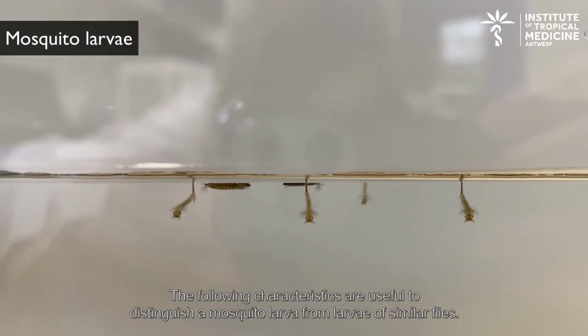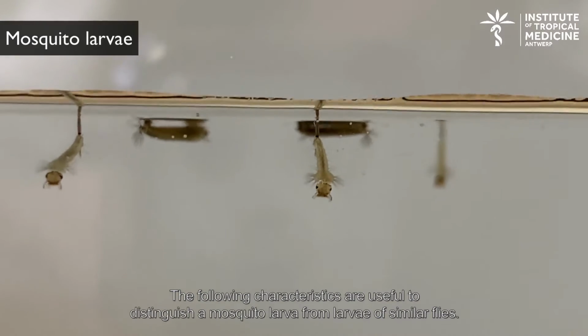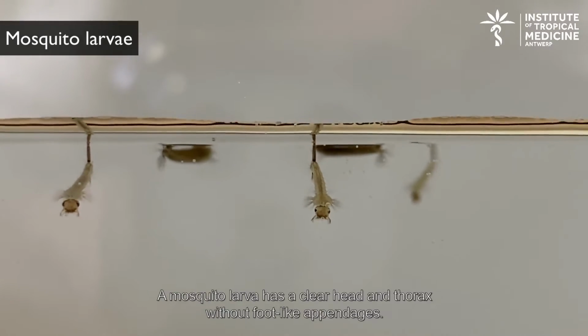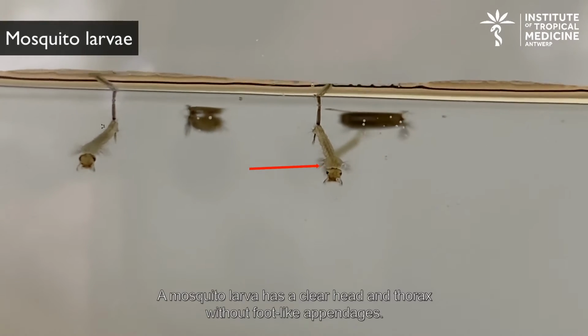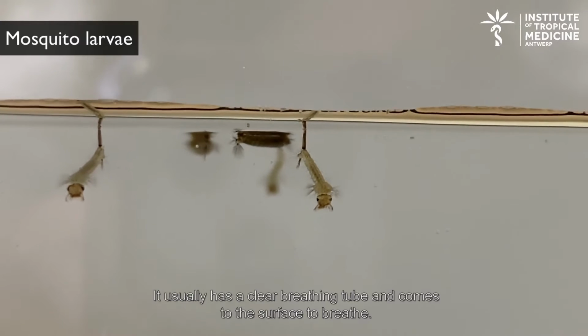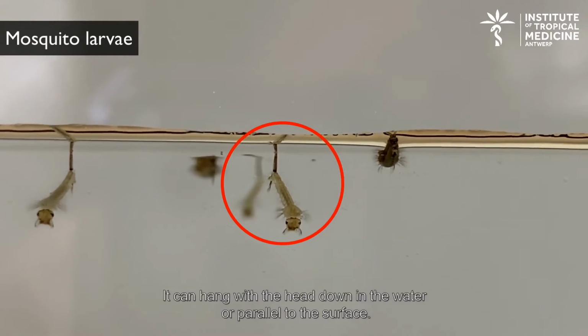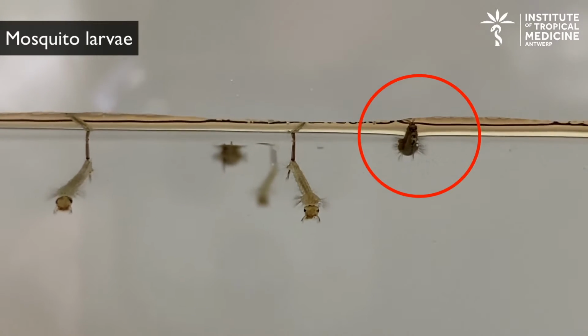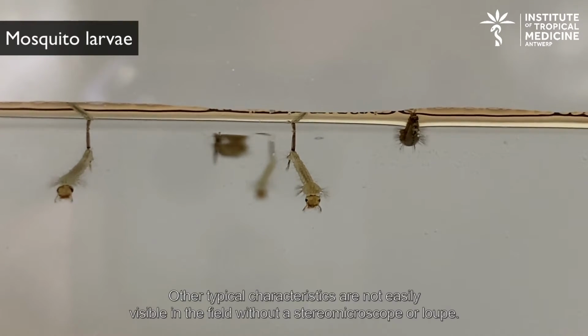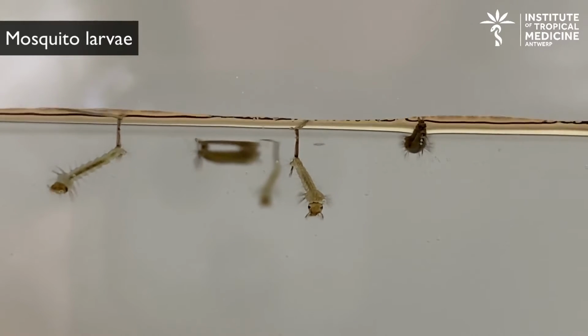The following characteristics are useful to distinguish a mosquito larva from larvae of similar flies. A mosquito larva has a clear head and thorax without foot-like appendages. It usually has a clear breathing tube and comes to the surface to breathe. It can hang with the head down in the water or parallel to the surface. Other typical characteristics are not easily visible in the field without a stereo microscope or loupe.